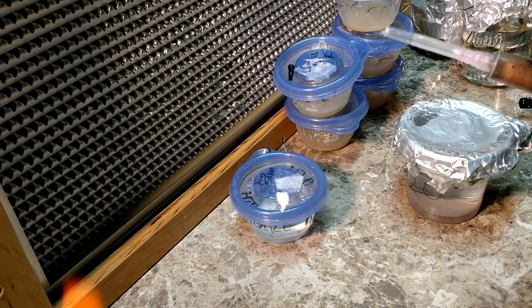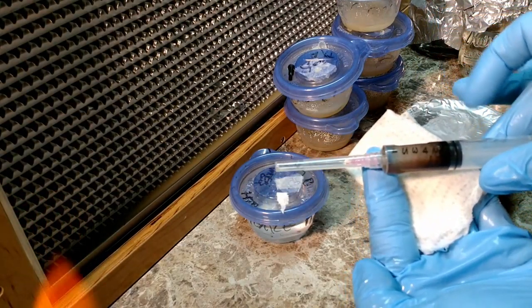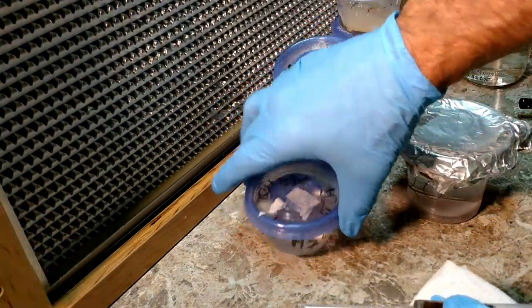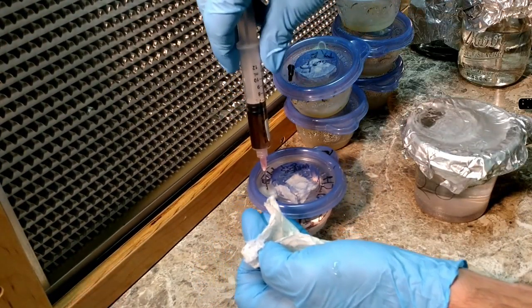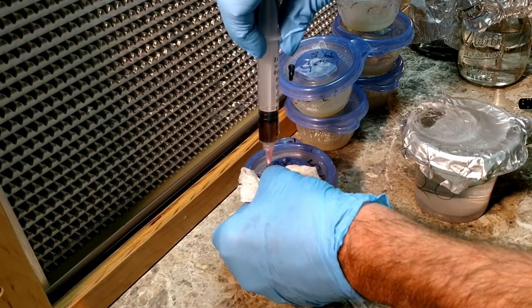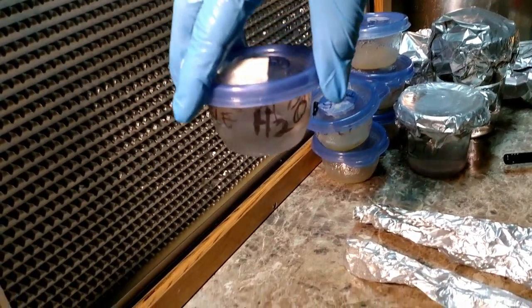We have — what is that — six, I call that six. You can see how dark that is. Nice, so six milliliters in here, but we want more. So what we're going to do is, we have a petri plate that's just straight water. If you watch the side, it's going to take about two cc's in there, pull it out. What I have now is a petri plate full of water — I'm going to risk my sterility here for you people — petri plate full of water and spores.